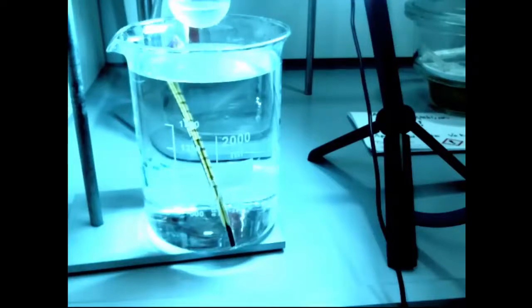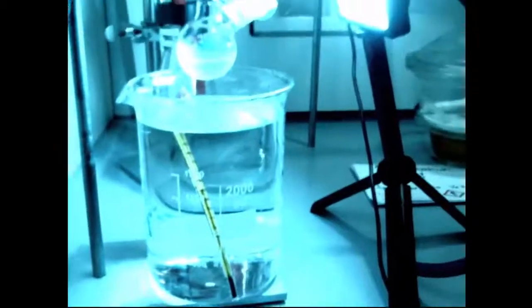This is now at 40 degrees, or about a bit higher. Some warm water out of the tap. You'll see the thermometer in a bit. And I'm going to put the container in there and then pump on it to a vacuum. It'll take a little bit of time for me to get everything set up. So we're back to full speed again. Nothing happened at all at 20, and now we're trying it faster.